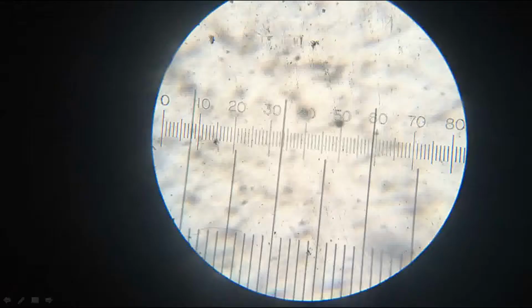For that, first we need to find the immediate or nearby coinciding line. We can see here that this line and this one are coinciding. In the scale, wherever you can locate the nearby coinciding line, that doesn't matter. Wherever you locate, whatever it be, the number of division will always be same. Anyway, in this adjustment, I locate this line as the first coinciding and this one as the second.